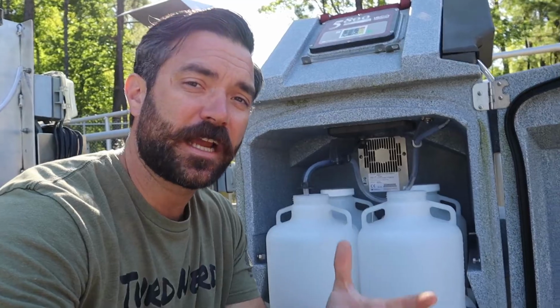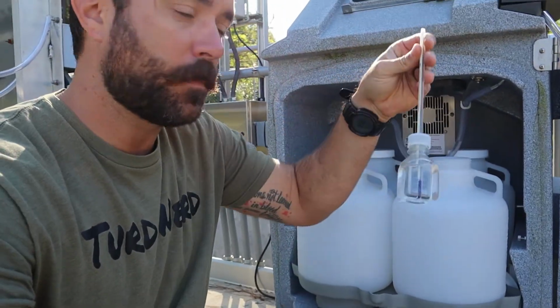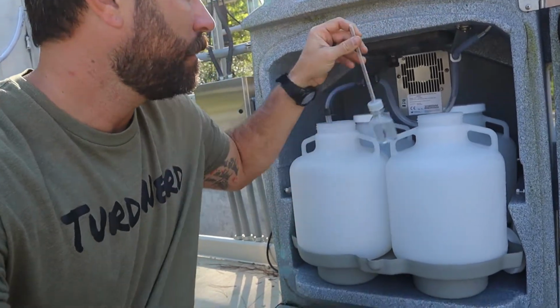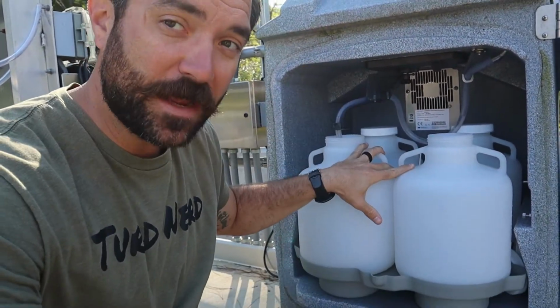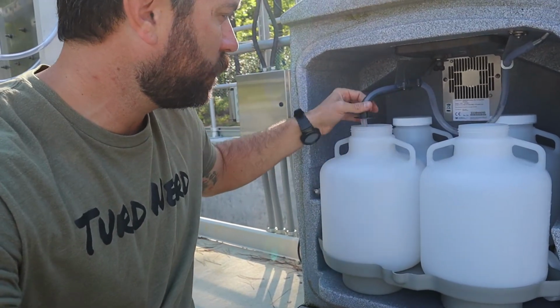It comes back to that documentation. I have that checklist. We also have these thermometer checks in here, so I'm going to look at that. I'm going to mark that on my checklist, and that right there is verifying that the temperature I have it set at up here is in fact what it's staying at in here. So now that we know we have our carboy in here and our hose in there, we can go ahead and close that back up. I'm sorry if that gets loud.